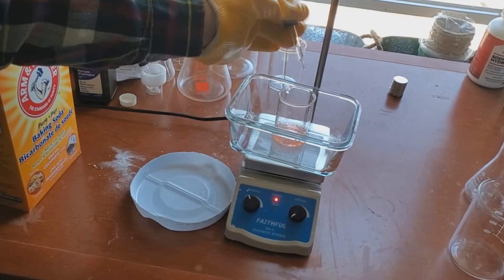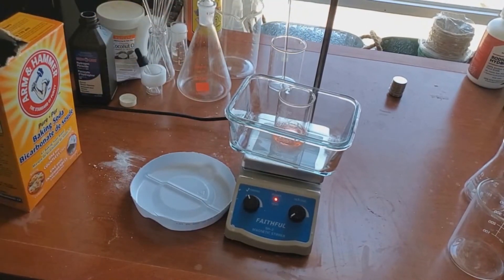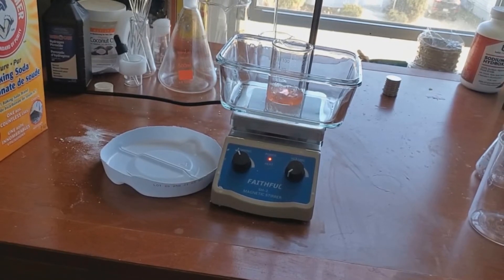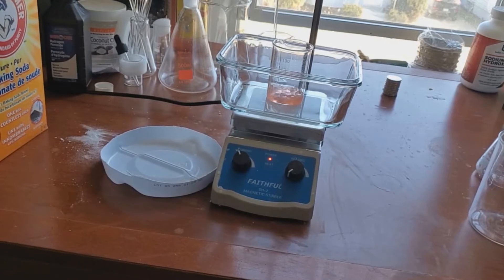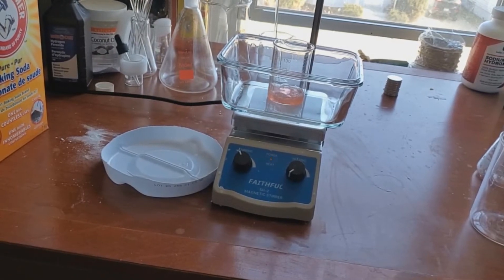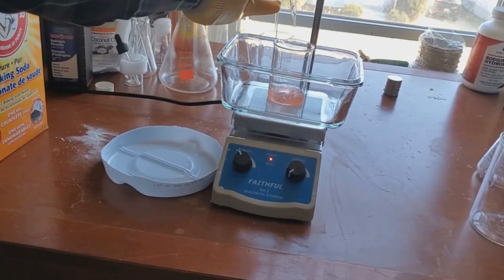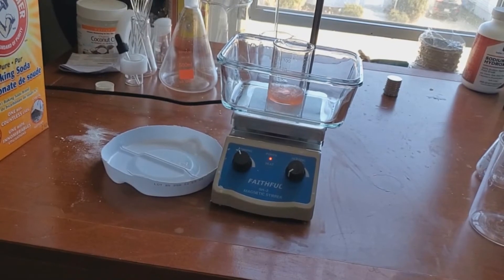If too much hydrogen peroxide is used, it can become extremely dangerous and even explosive. You may have also noticed that the sulfuric acid from the drain cleaner is colored. Mine is a dark shade of red, but it differs between manufacturers. That is just an agent to stop the sulfuric acid from attacking metal in the drains and reacting to other random chemicals within pipes and all that.